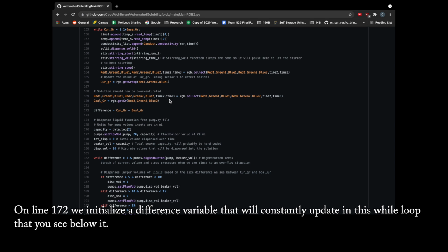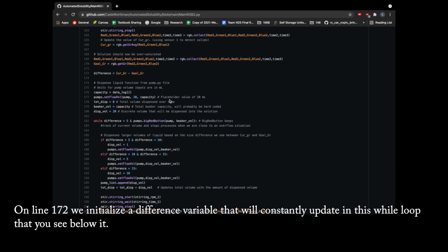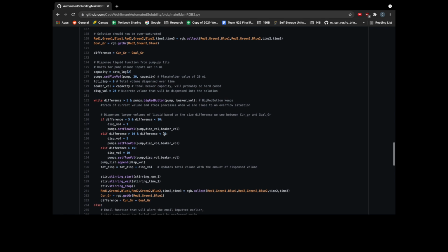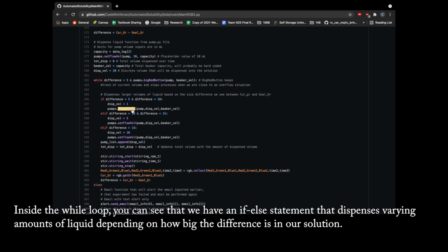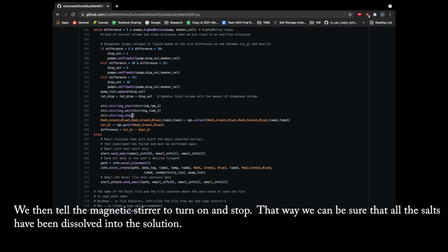On line 172, we initialize a difference variable that will constantly update in this while loop that you see below it. This while loop also has a big red button function attached to it, which will stop this whole while loop if a beaker gets too much liquid and starts to overflow. Inside the while loop, you can see that we have an if-else statement that dispenses varying amounts of liquid depending on how big the difference is in our solution. We then tell the magnetic stirrer to turn on and stop. That way we can be sure that all the salts have been dissolved into the solution.